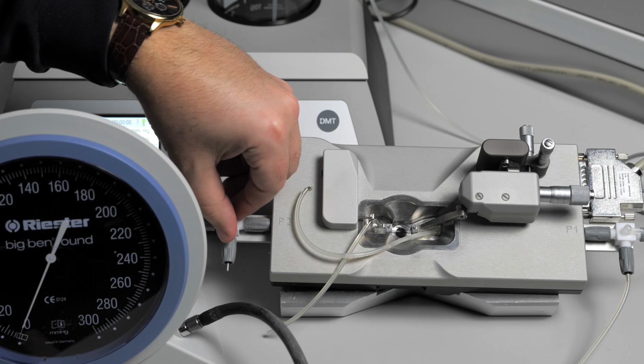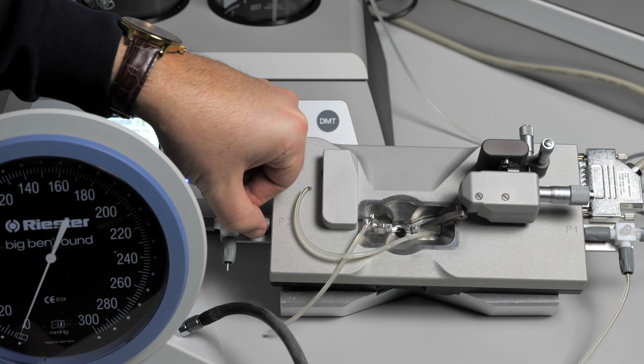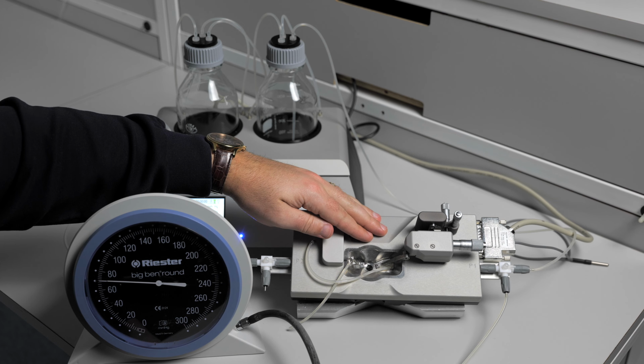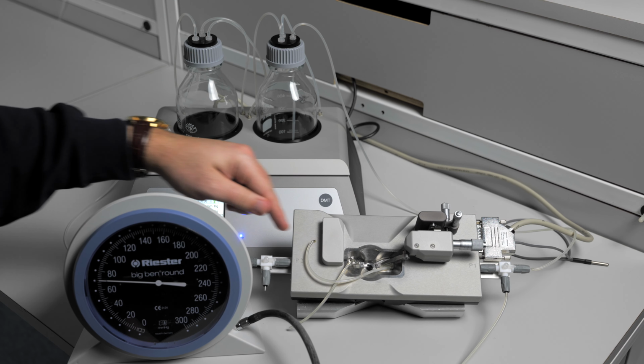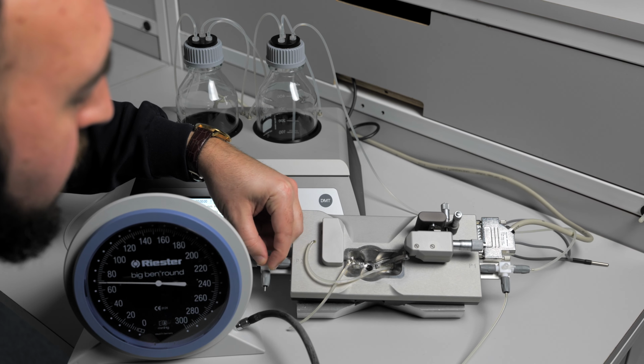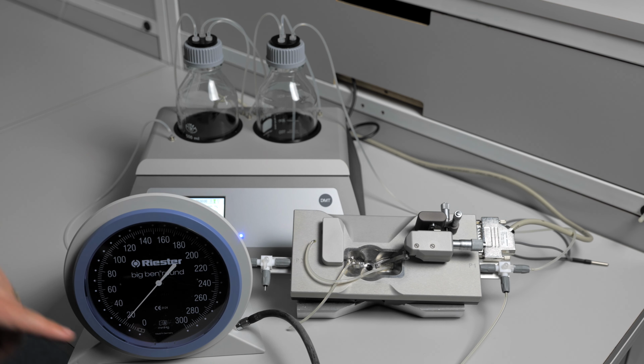If you were to close the P2 three-way valve to the chamber and add pressure and it holds steady, then you know that your chamber is not the cause of your pressure leak and that the leak is after the chamber. Open the P2 three-way valve and you see that we have our pressure leak.